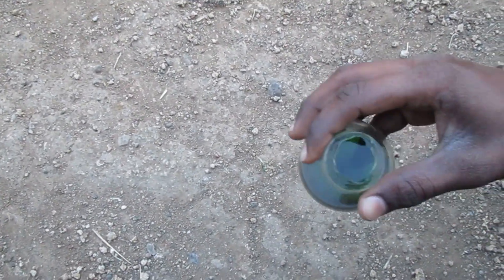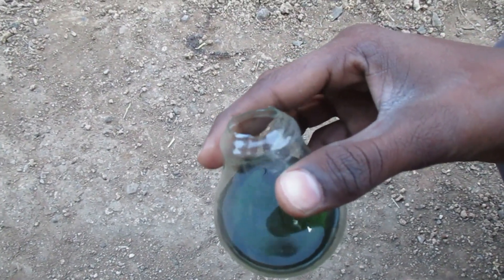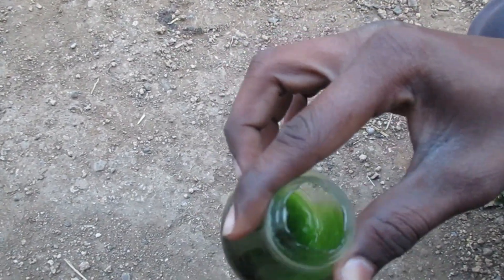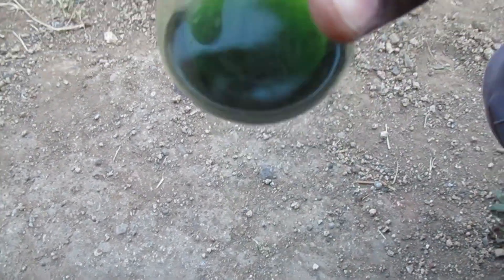Now, after 12 hours, see this — the hydrochloric acid we put the tungsten in has changed into the green color. See that. And the tungsten has also disappeared, you can see — it has disappeared.